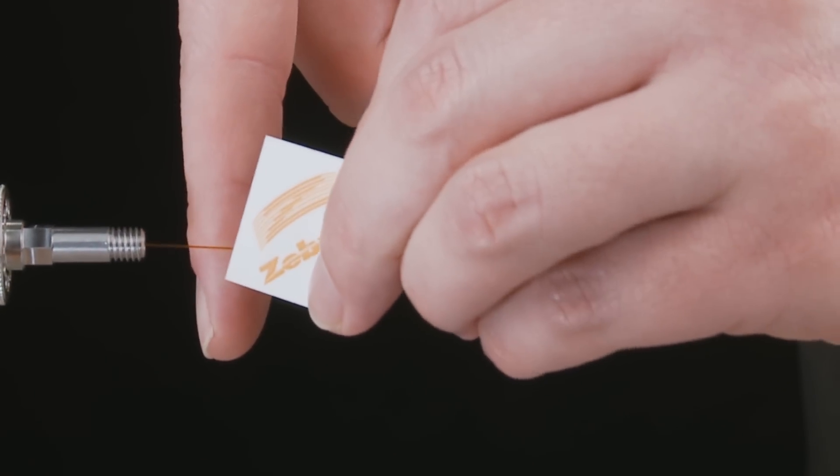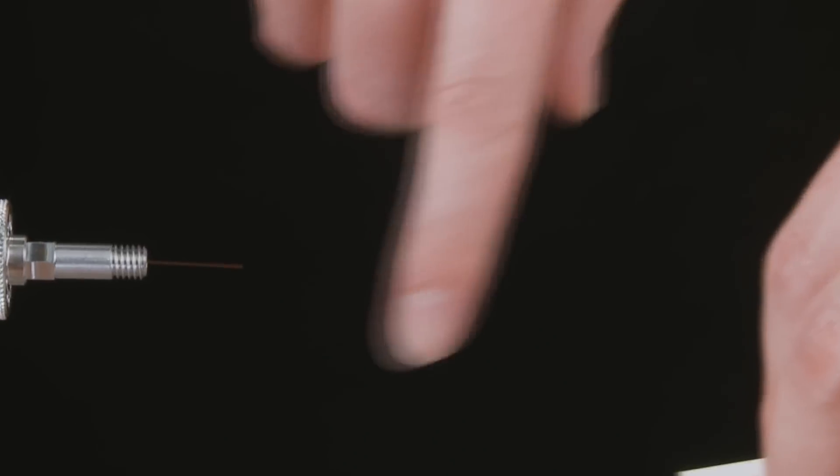Using a scoring wafer, cut one centimeter of the column. This will remove any graphite or ferrule residue that results from inserting the column through the ferrules.